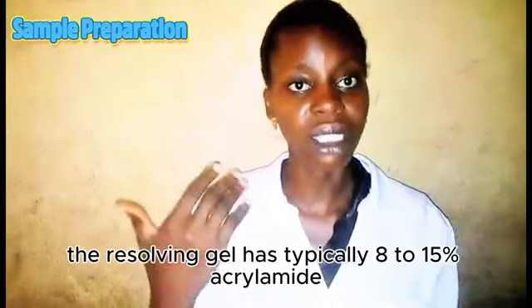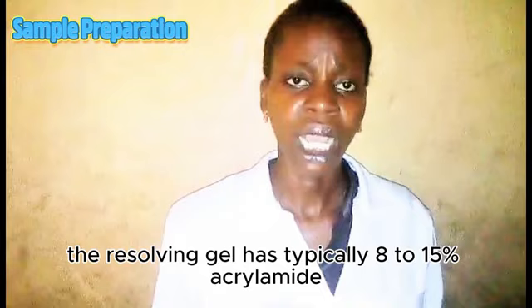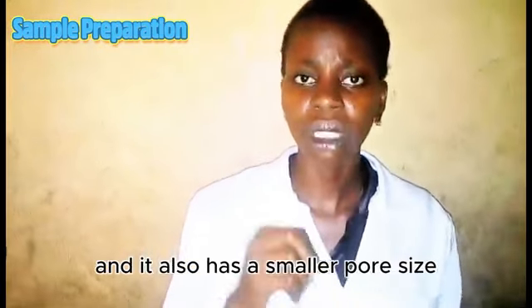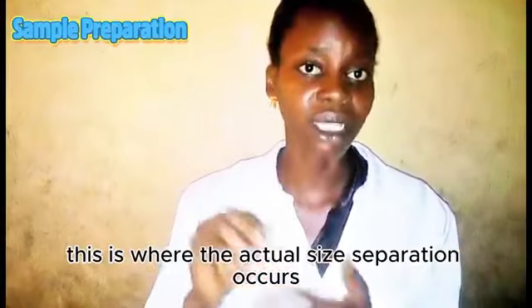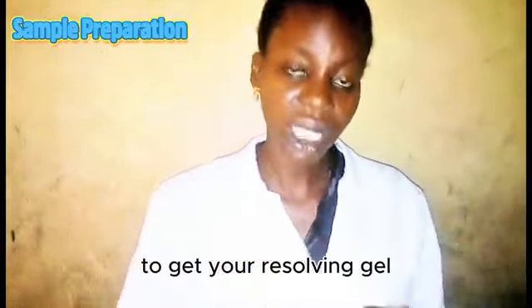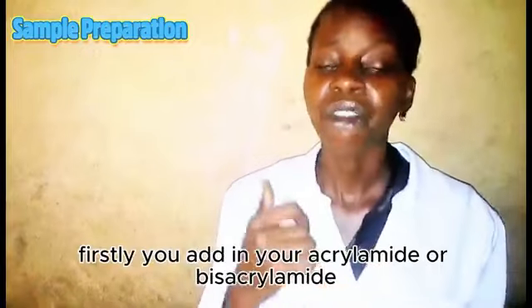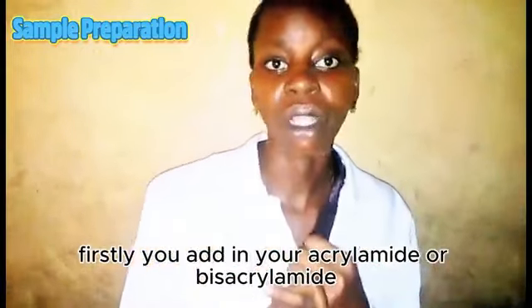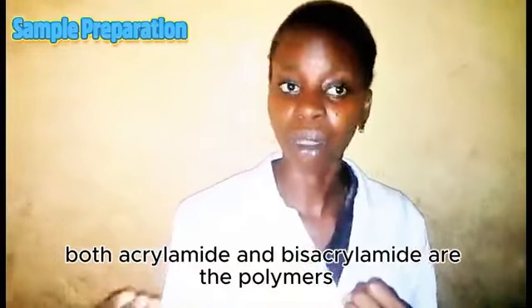The resolving gel has typically 8 to 15% acrylamide, and it also has a smaller pore size with a higher pH of 8.8. This is where the actual size separation occurs. That's how to make your resolving gel. Firstly, you add in your acrylamide or bisacrylamide. Both acrylamide and bisacrylamide are the polymers.